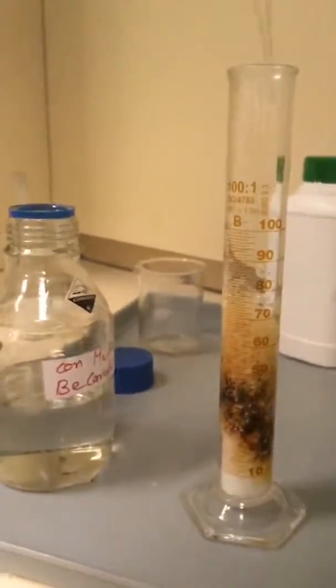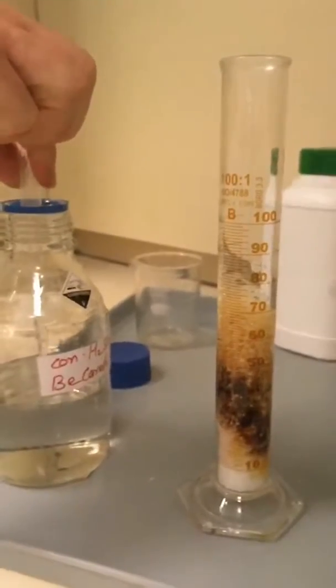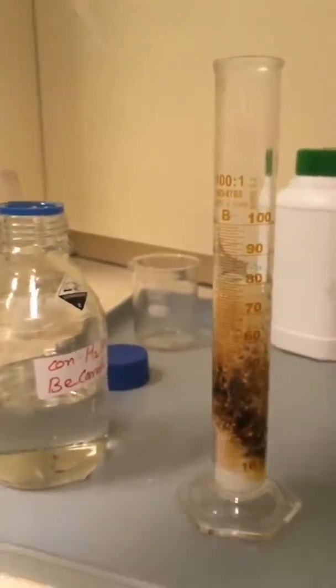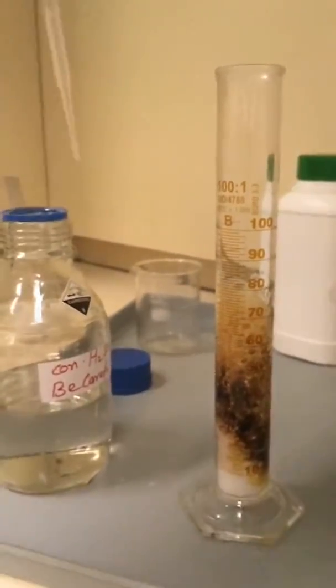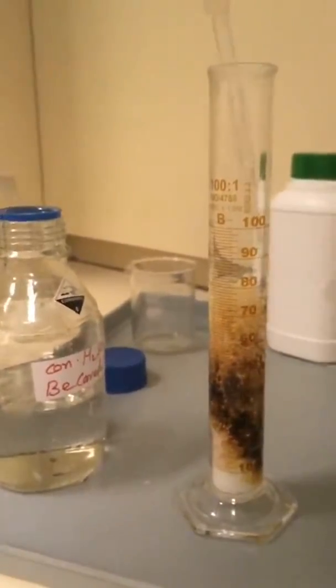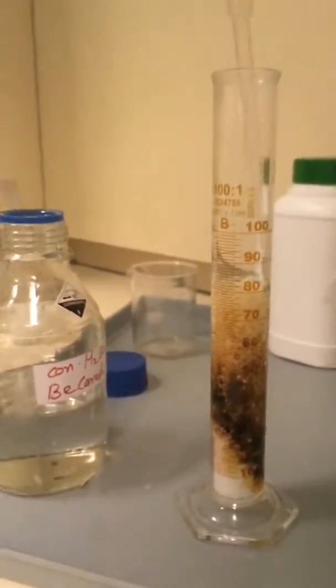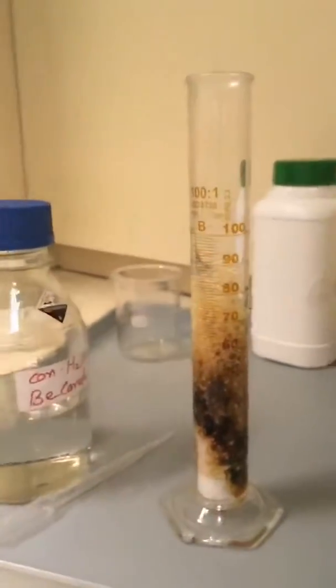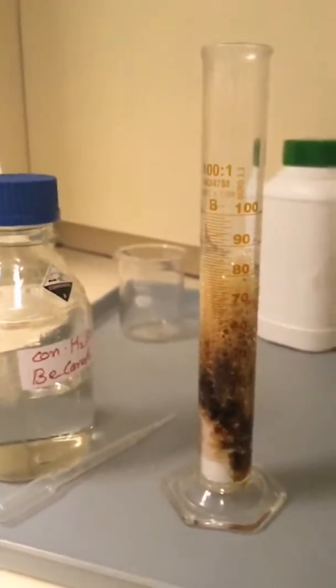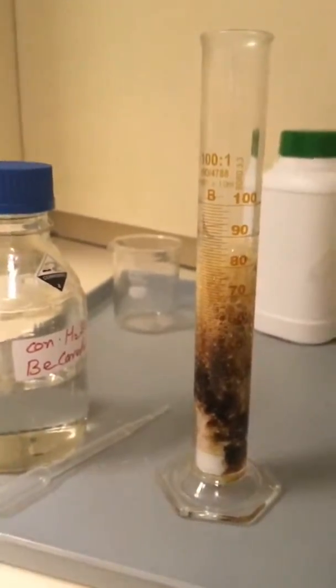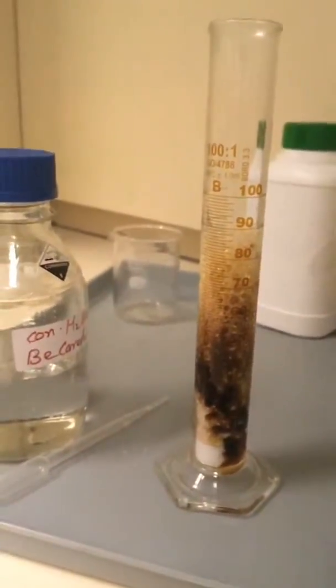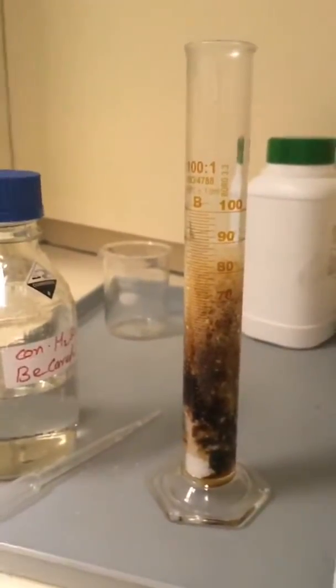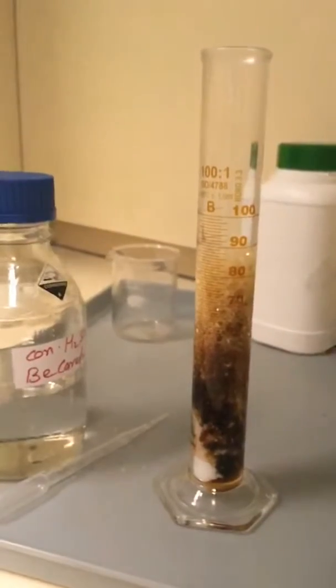You keeping the camera still, Joshua? Yeah, good man. Right, so now your skin has turned black. You are howling on the floor in absolute agony. Your skin has just been reduced to carbon, just this black mass, sludgy mass. And as the sulfuric acid works, it's a little bit of magic. It starts to increase in volume.